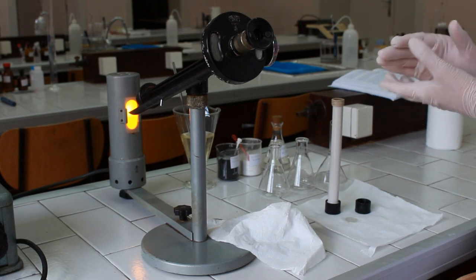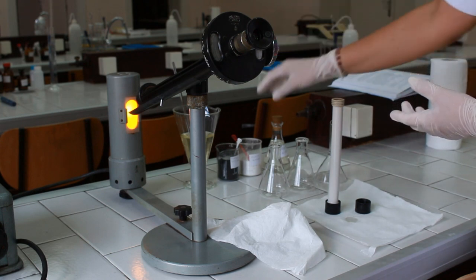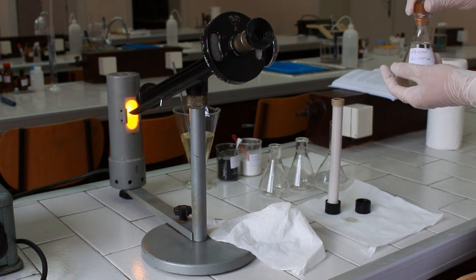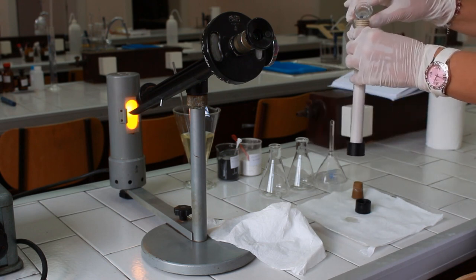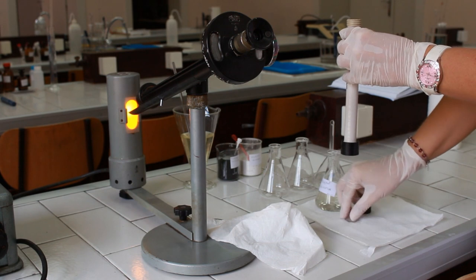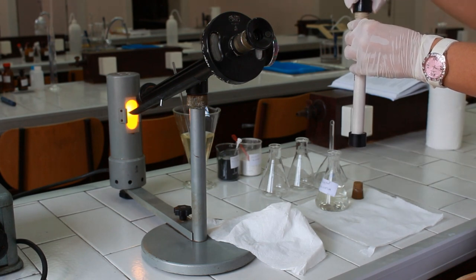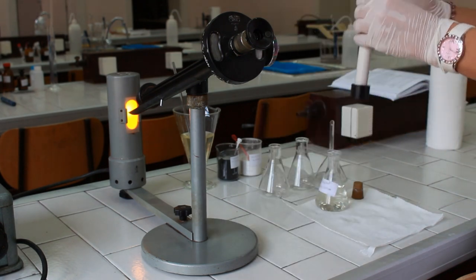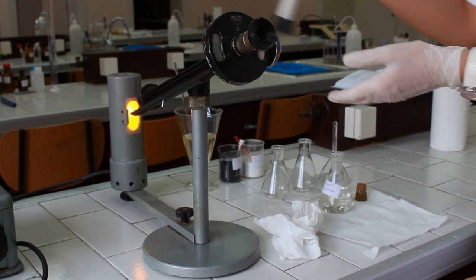The next part of the experiment is to determine the specific angle of rotation for a glucose solution. For that purpose, we are going to take a solution of glucose of known concentration — usually we use a 0.2 g per milliliter solution — and pour that solution into our polarimetric tube. Put the glass and close the polarimetric tube. Wipe it gently.